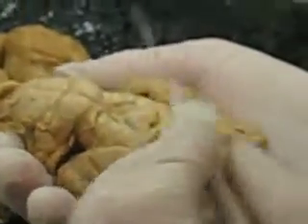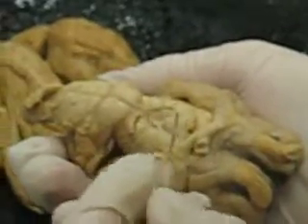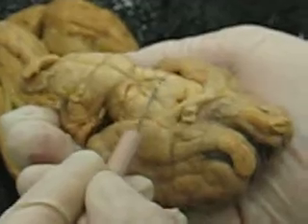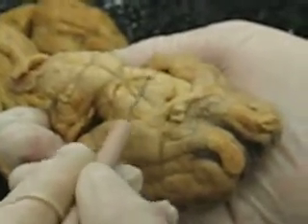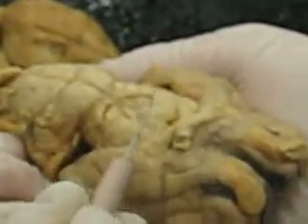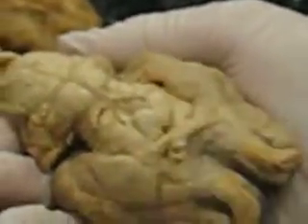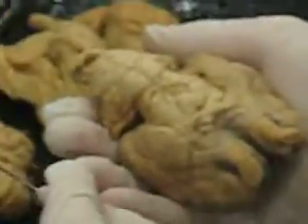Infundibulum and the hypophysis. Hypophysis is another name for the pituitary. They're gone on this particular structure. They should be right here over the mammillary body. It's a little pea-like structure, and it's attached to the brain by way of a stalk, or infundibulum. You'd be very lucky to actually see that pituitary gland on the brain. You might see it on the sections.